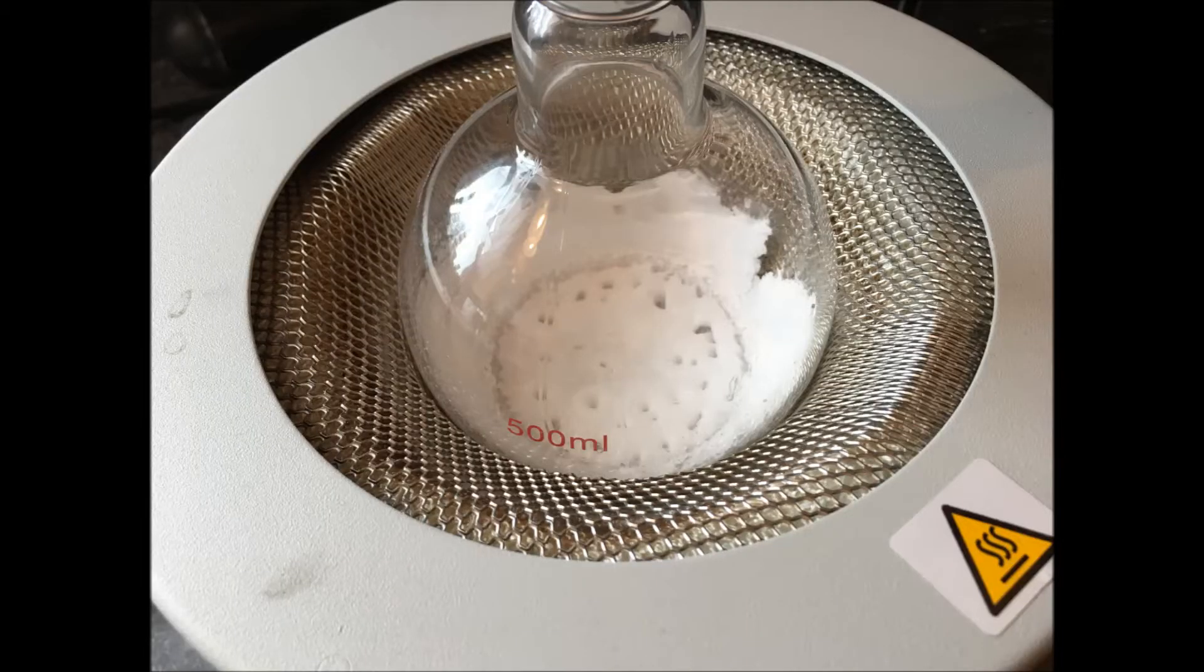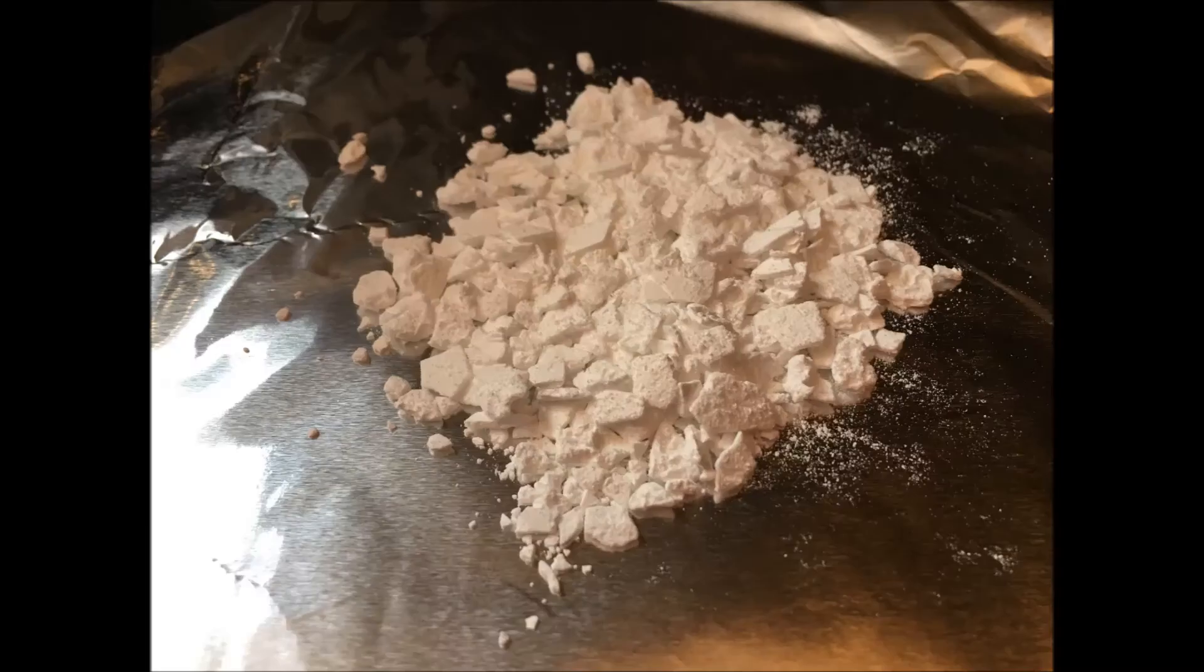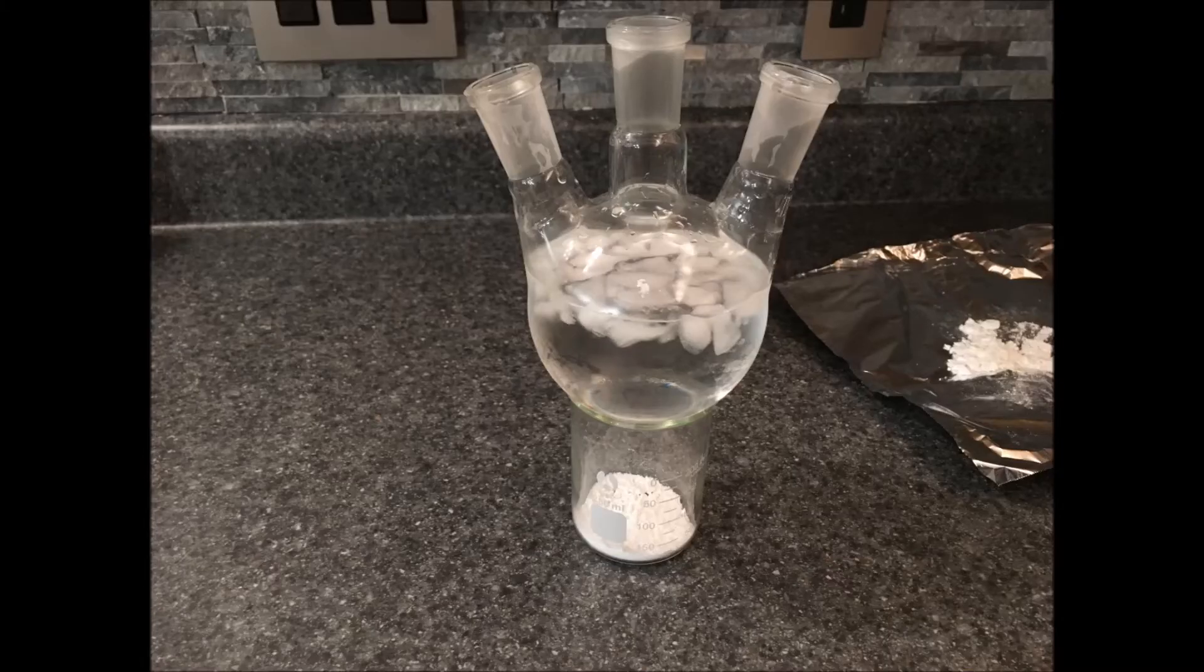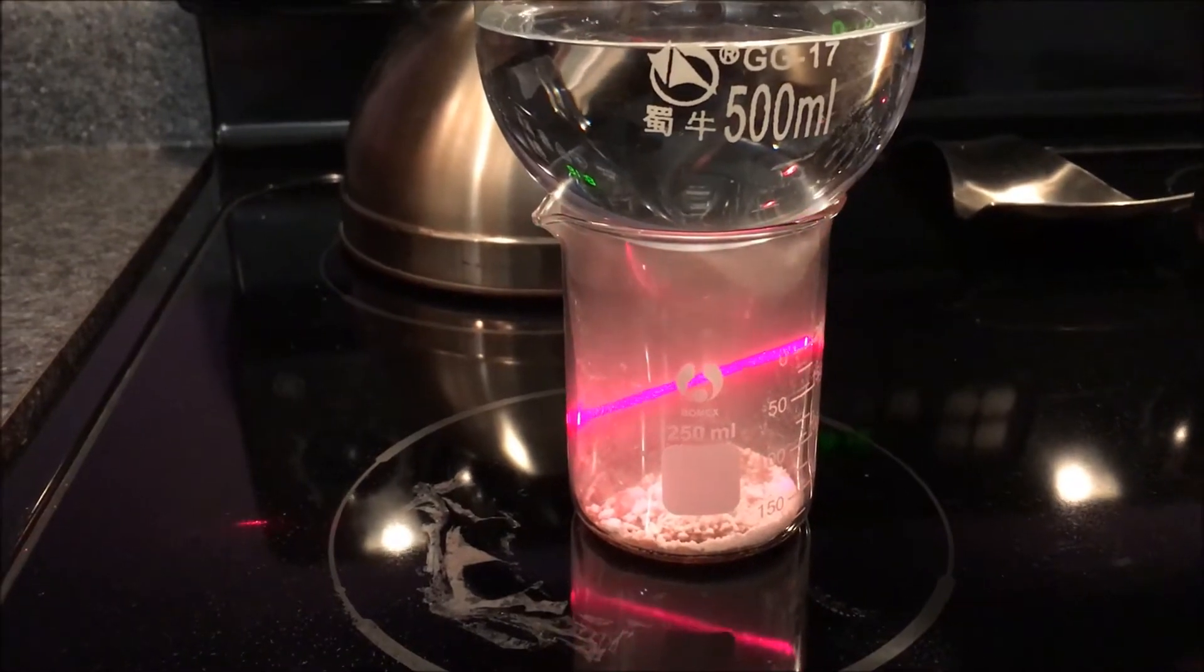You should be left with a nice chunk of caffeine in the flask. I set mine out in the open to get rid of any solvent. I then further purified my caffeine by sublimation.